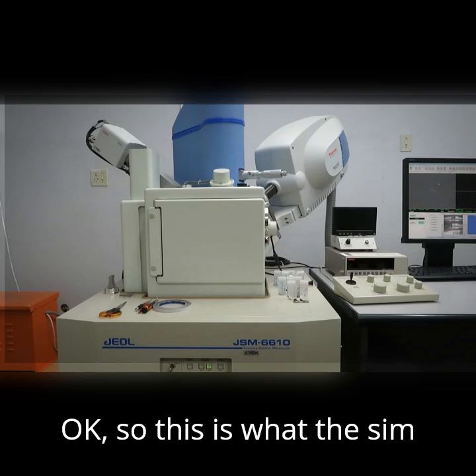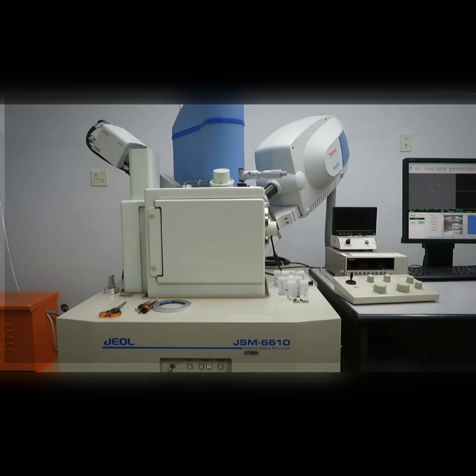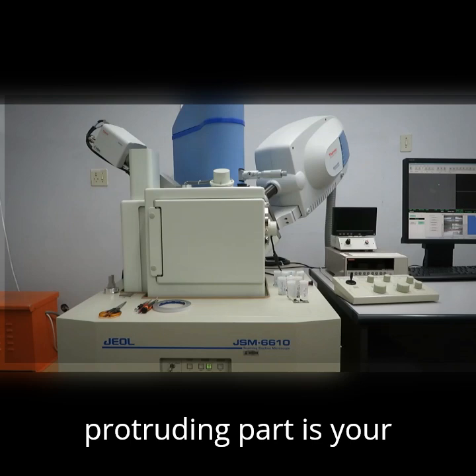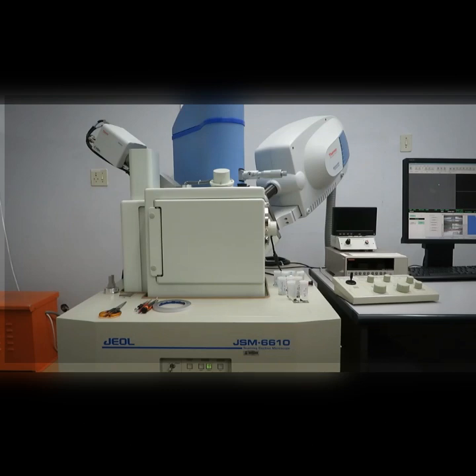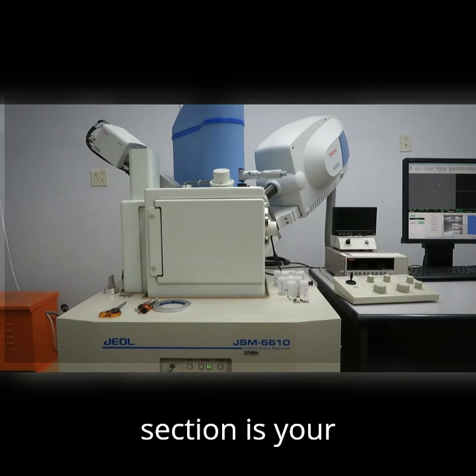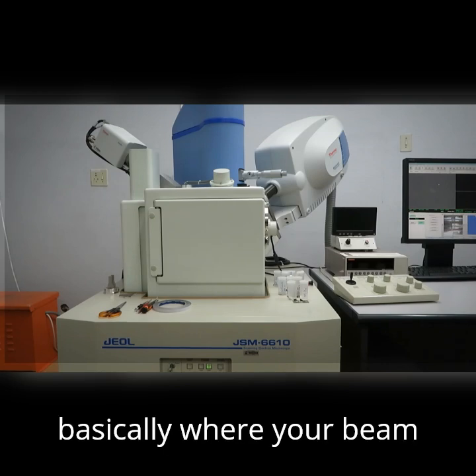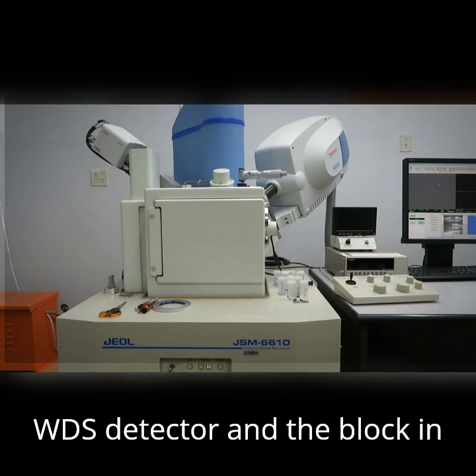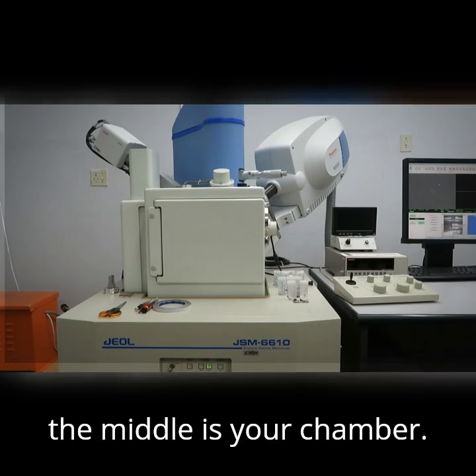Okay, so this is what the SEM looks like at the Geology department. It is a JEOL JSM 6610. On the left hand side, that protruding part is your EDS detector. The blue section is basically where your beam forms. On the right hand side is your WDS detector, and the block in the middle is your chamber.